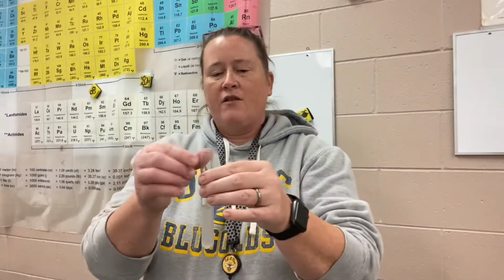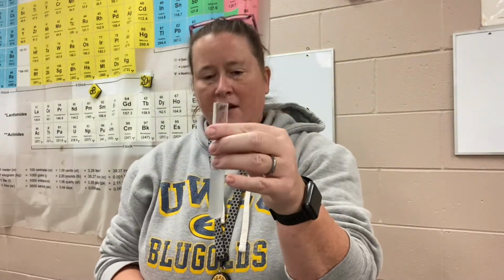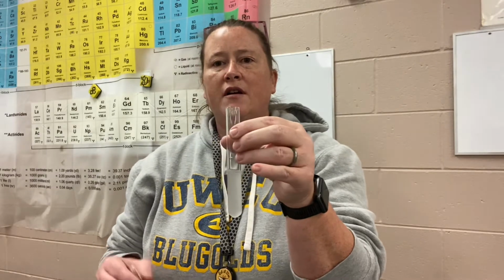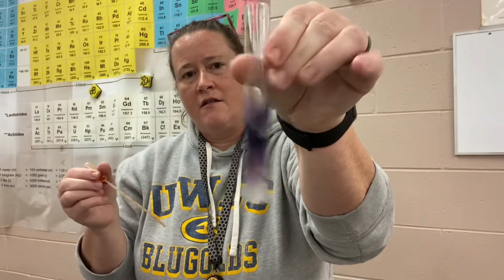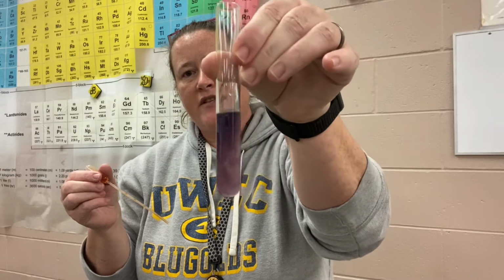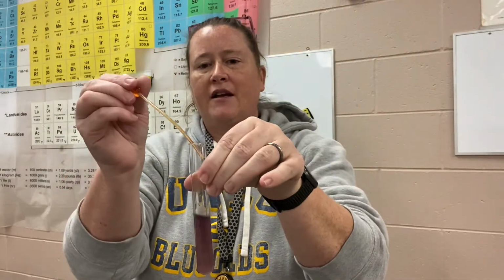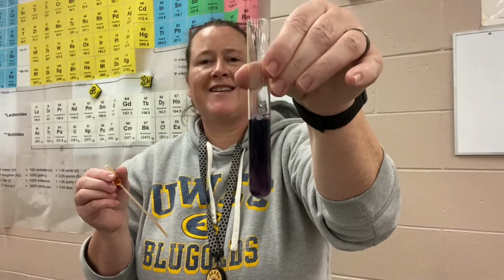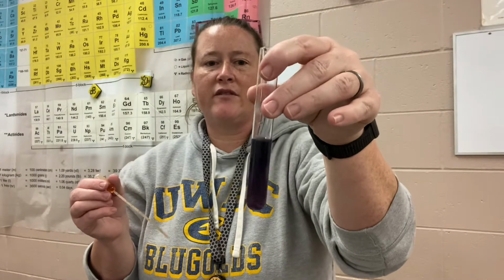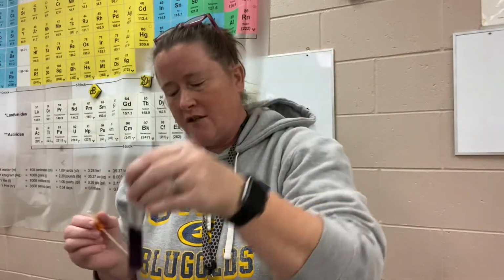Now, iodine, when exposed to starch, will turn a specifically bluish black color. So this is a characteristic color for iodine reacting with starch. And this can be used as a test if you're testing different foods for starchiness. So iodine with starch turns this characteristic blue color.